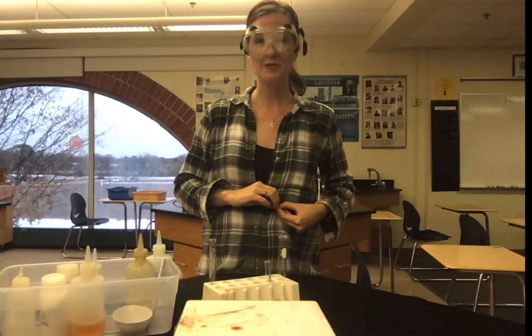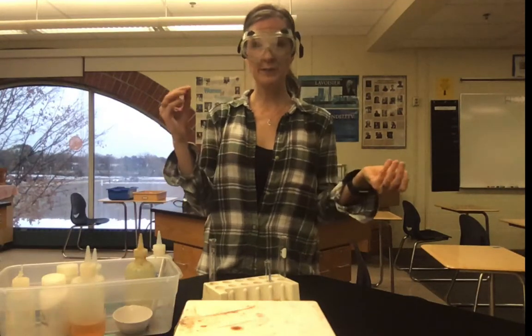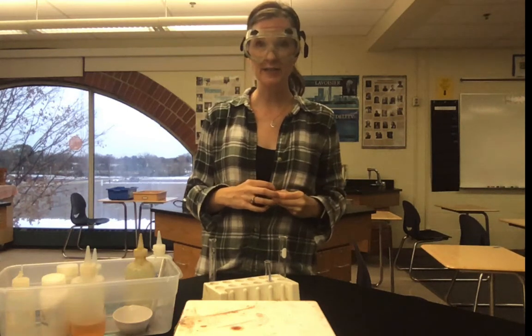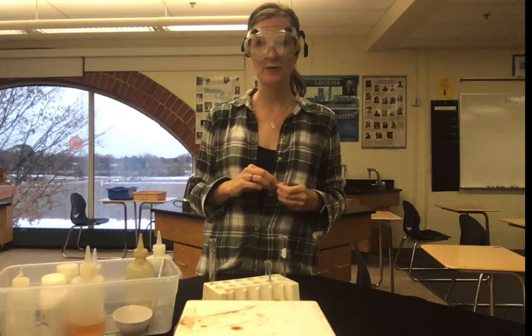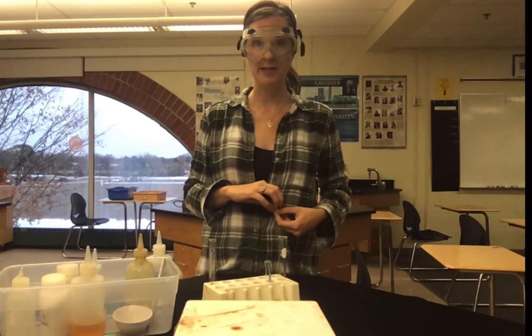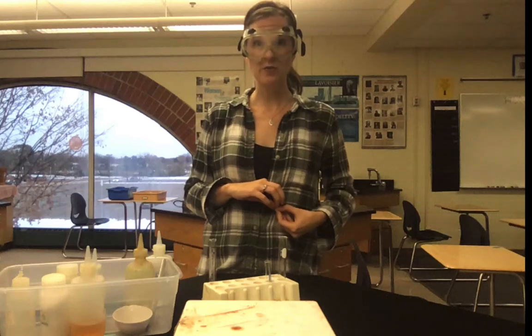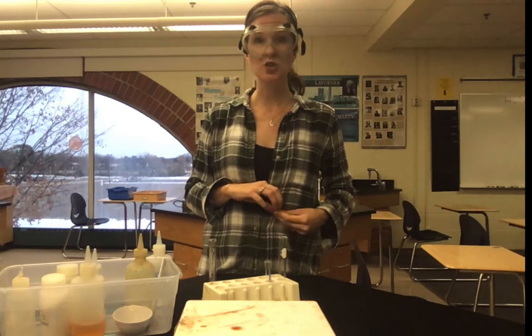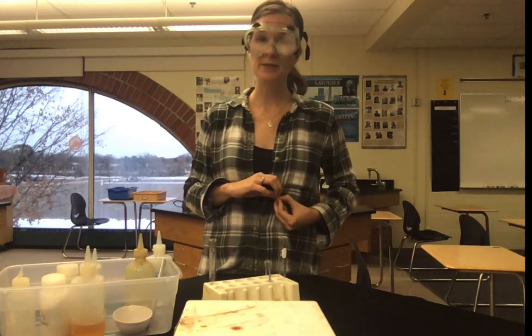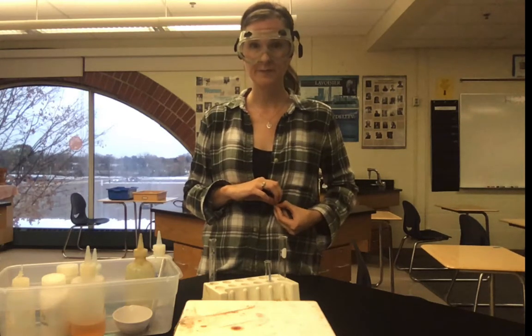This experiment will serve to show you the 4 different experiments related to the chemical physical changes lab. This will allow you to gather the evidence that you need in order to understand whether it was a chemical or physical change that occurred over the course of that experiment. In addition to watching this video, in order to gather the evidence, you should be completing the pre-lab, which is the work to make sure you're understanding the concept of chemical and physical changes.